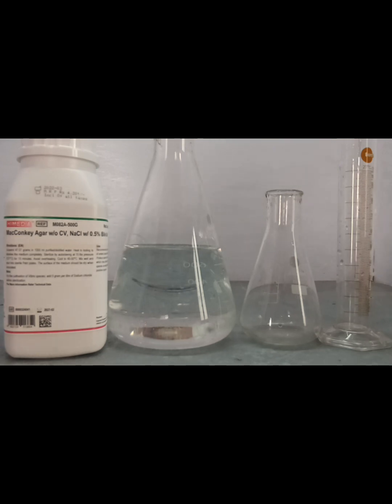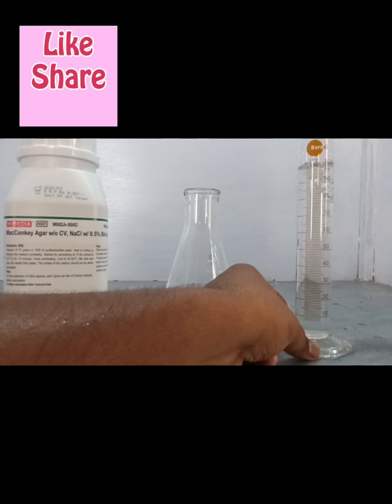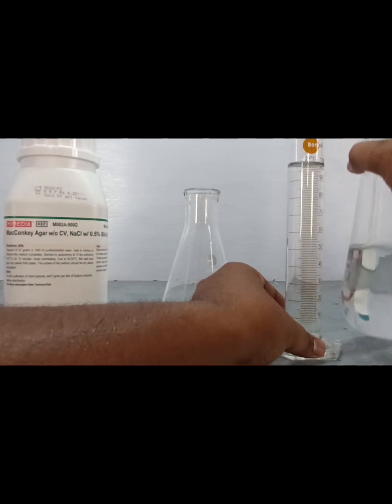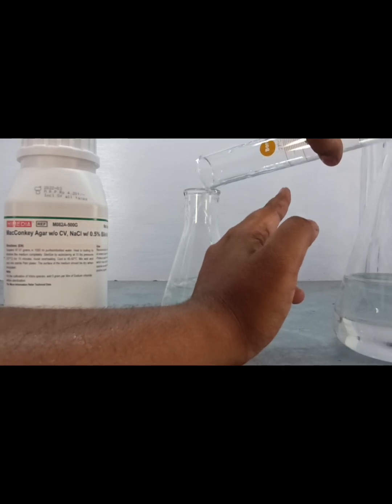Before performing the MacConkey agar preparation, we have to measure the water. We are measuring the water carefully — 100 ml — for a total of 200 ml of distilled water.